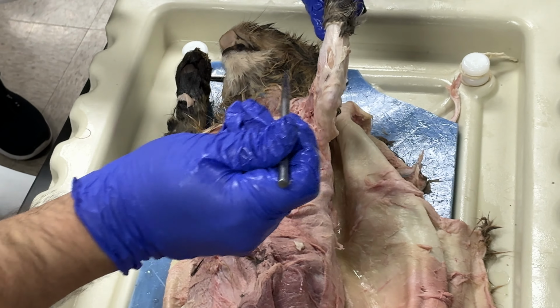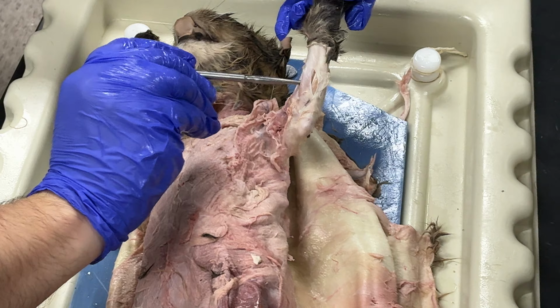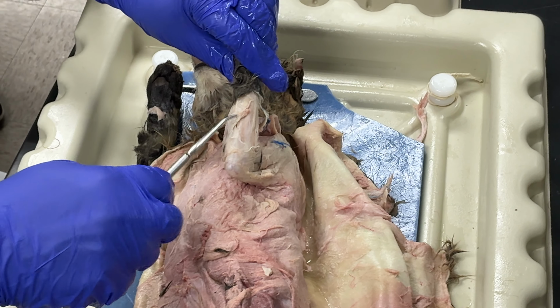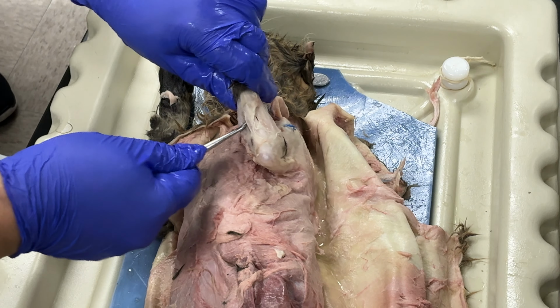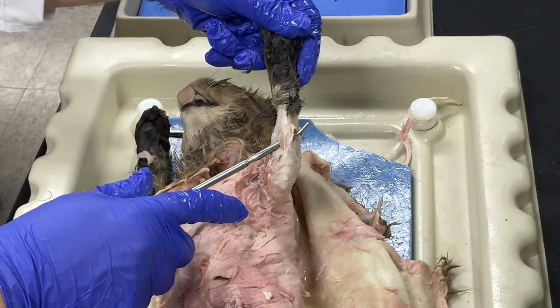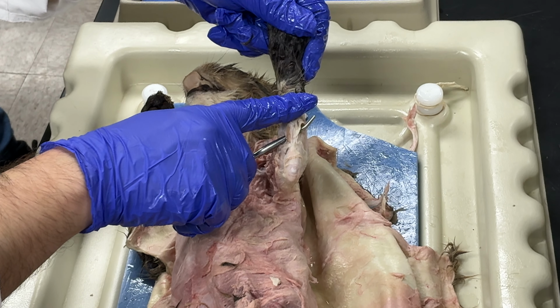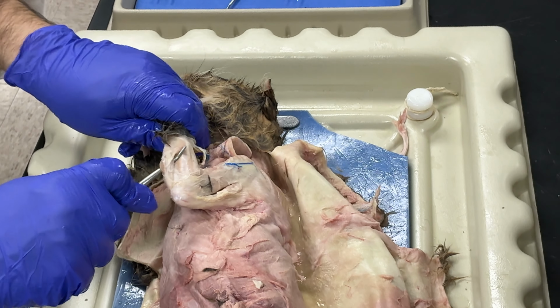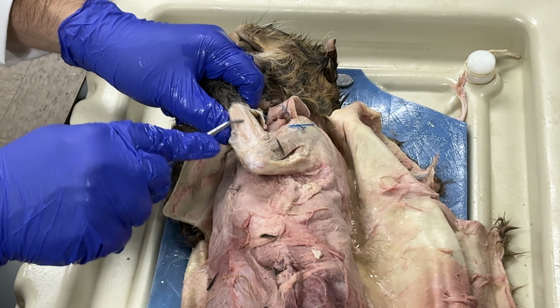And then in the forearm, on this side, I have a muscle right here. This one is the palmaris longus muscle. This is the palmaris longus. On this side, next to it, I have a muscle that I'm gonna see. This one is the flexor carpi ulnaris, and then next to it, this muscle is called the extensor carpi ulnaris.